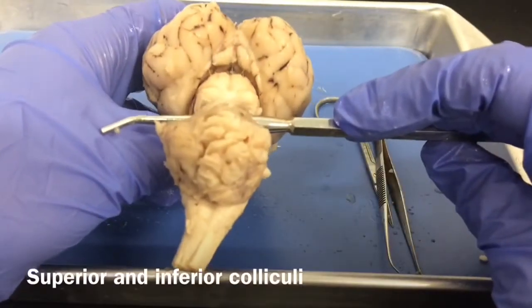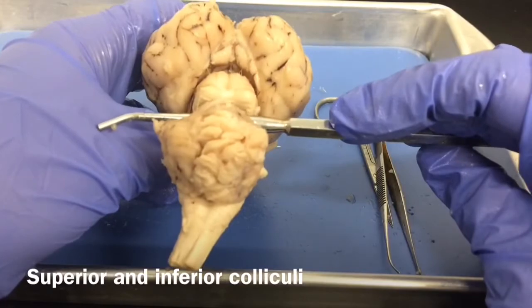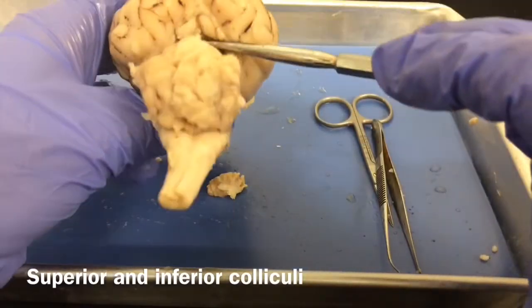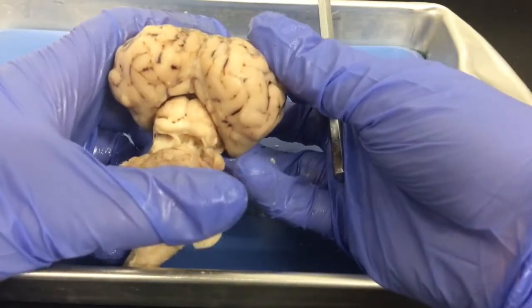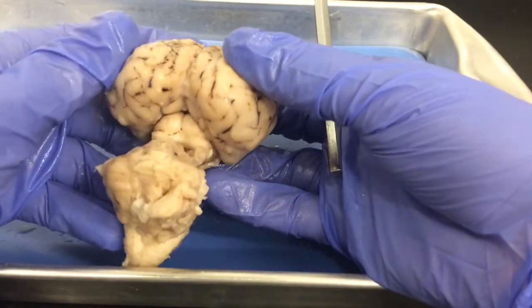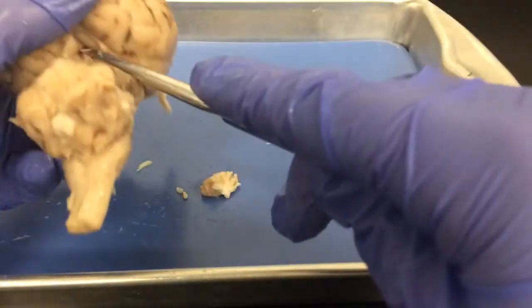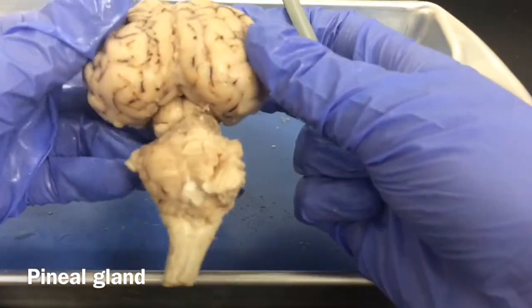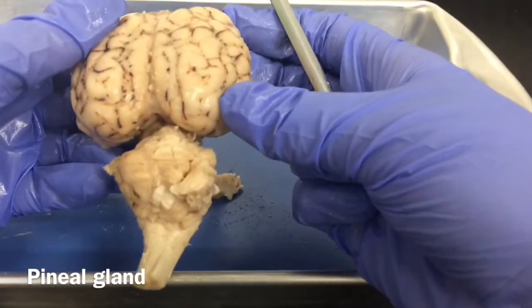So if we look at our brain like this, we can see our superior and inferior colliculi, and we can also just barely see our pineal gland, which is going to be back in, oops. This pair is going to help us with optic reflexes and auditory reflexes in the brain. And the pineal gland, remember, which is inside here, is going to function as one of our endocrine glands that's going to help us secrete things like melatonin.